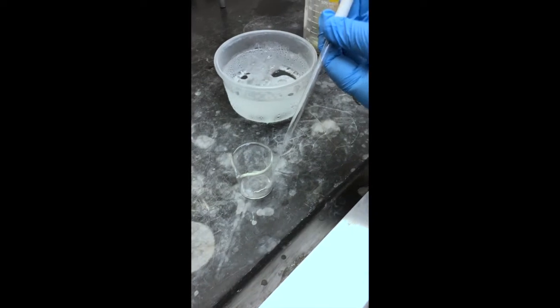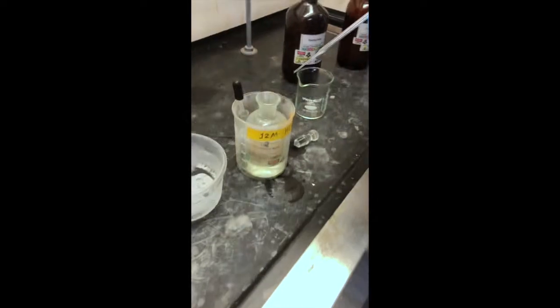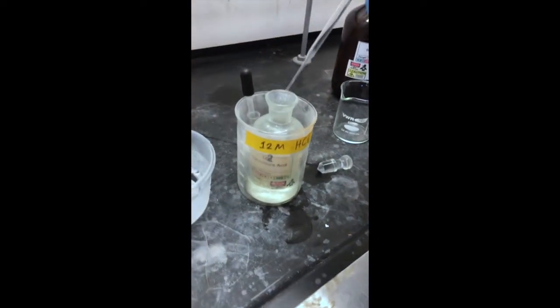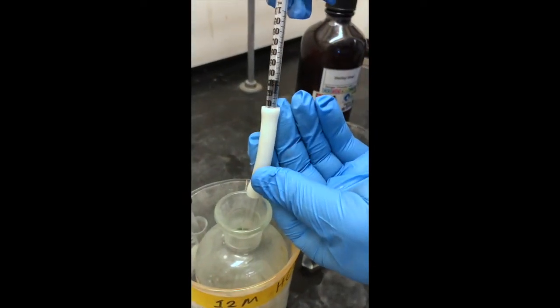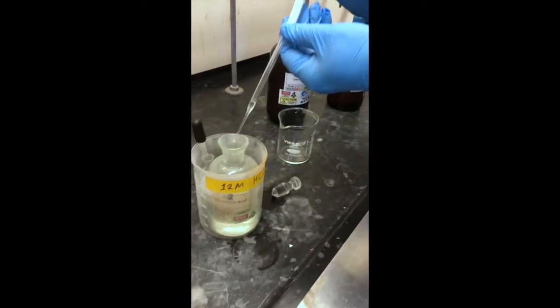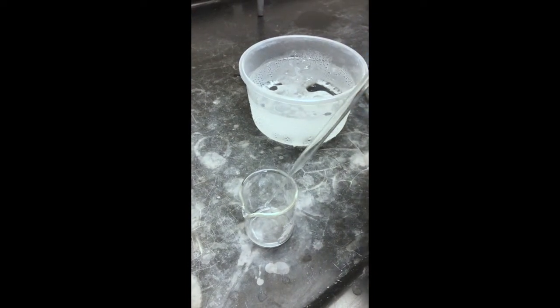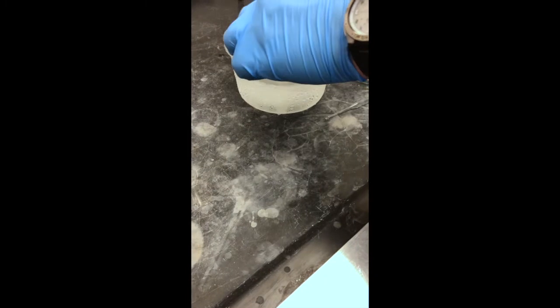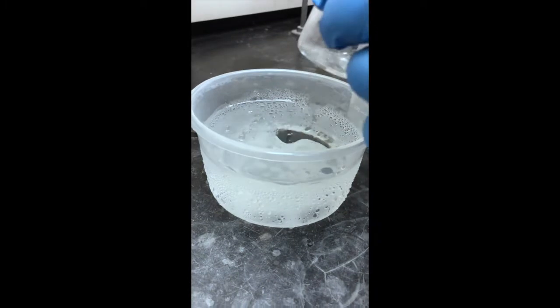We take some water, about half a milliliter, put it in a 30 milliliter beaker, put it on an ice bath, and add another 0.4 milliliters of the concentrated HCl. Again, normally you would not pipette right out of the container from the hood. We're going to add this to our water and then chill this solution so that we can prepare to pour our reaction onto this acidic solution. But remember, we ended up basic inside the reaction flask earlier.